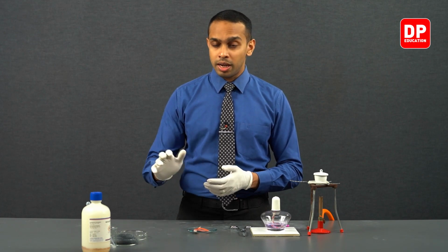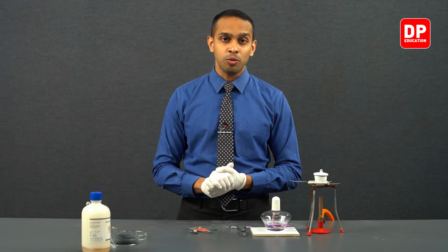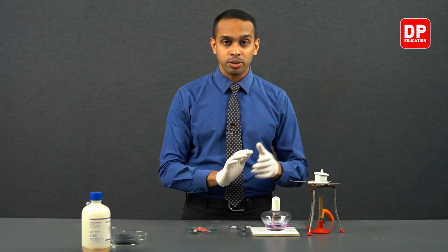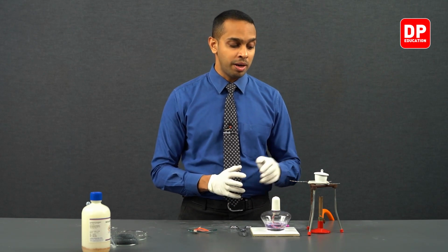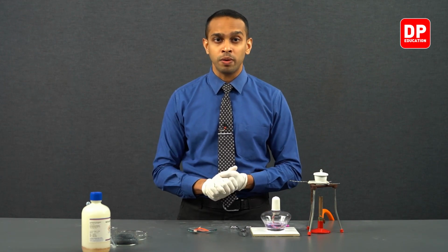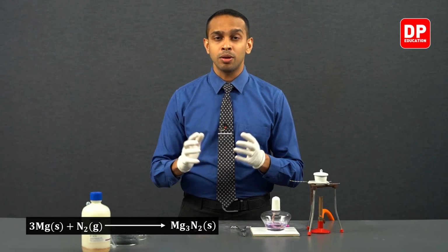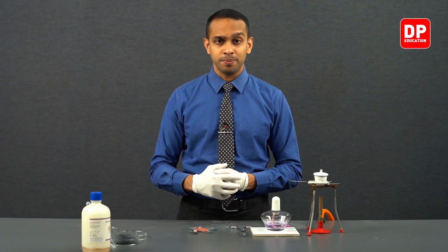Now, in our experiment, we will light this piece of magnesium. We will heat it until it ignites, and we will introduce it into this crucible, and we will close the lid, and we will allow the magnesium to react with the remaining amount of oxygen in this crucible and then start reacting more with the nitrogen inside this crucible, eventually producing both magnesium oxide and magnesium nitride.